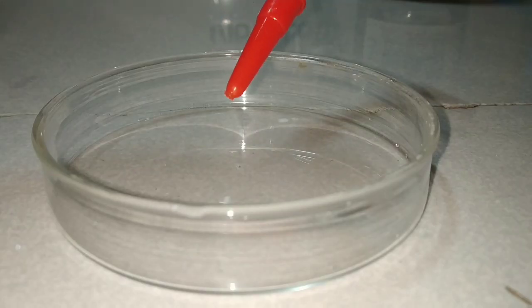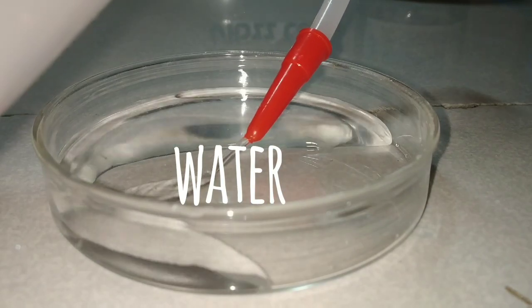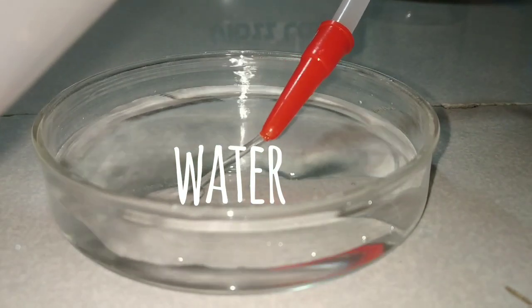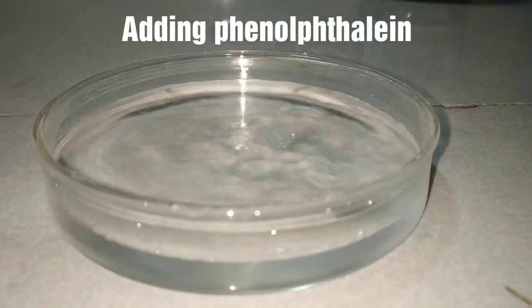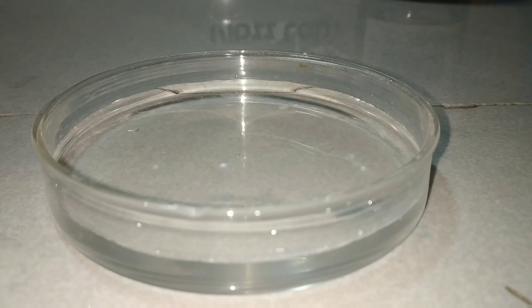The next experiment is the classical experiment which everyone knows, that is the reaction of sodium metal with water. I am filling this dish with water now. Now I am adding phenolphthalein indicator. This indicator becomes pink in alkaline medium.